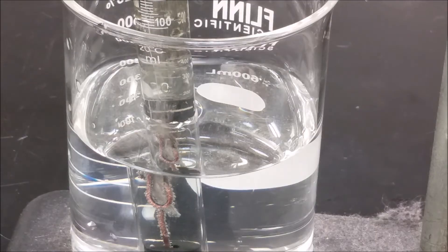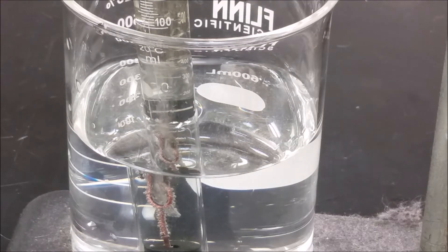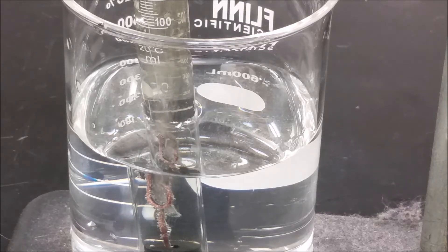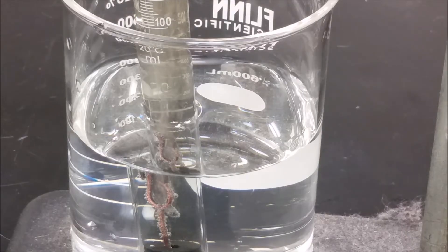Now we're going to speed up the video so this doesn't take so long because it's a long stretch for this reaction to happen. We're going to flip back and forth where you can see the bubbling and you can see what's going on at the top as the bubbles push that water and hydrochloric acid as that gas is collecting.